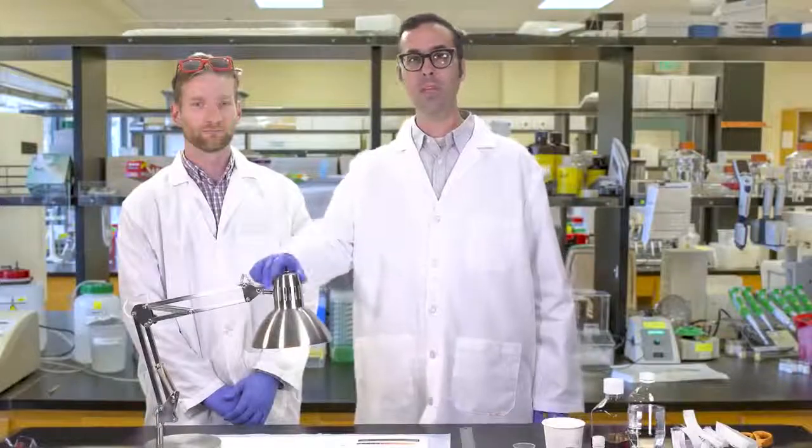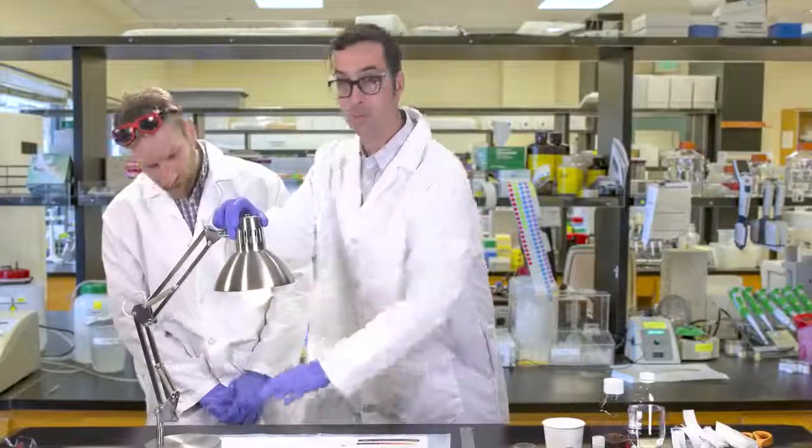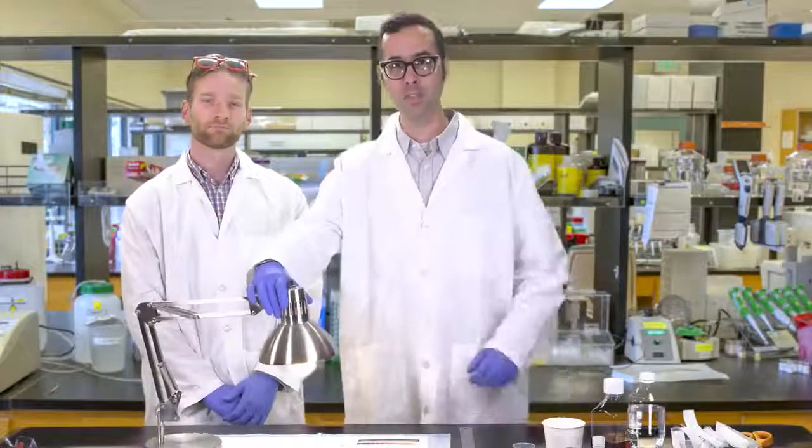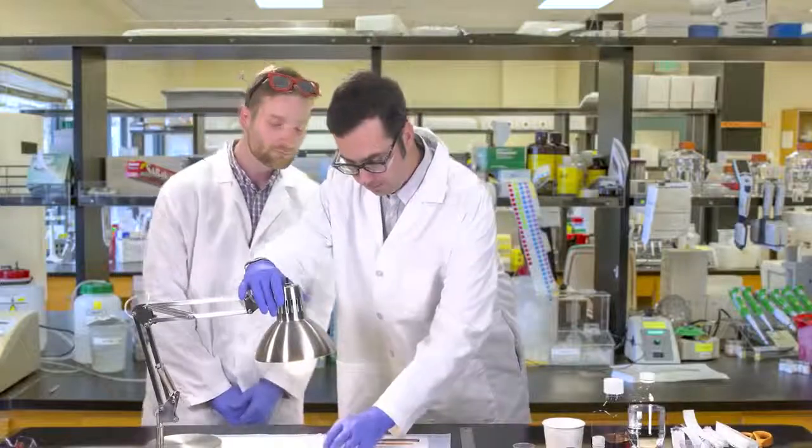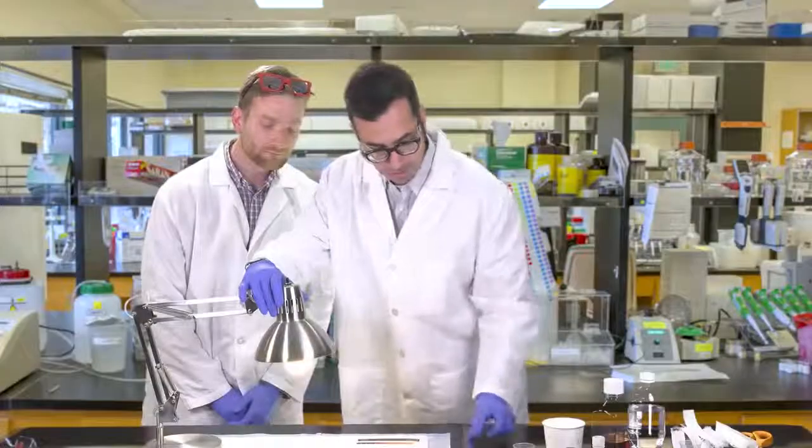Two, the light shouldn't be too close or too far from your beads. The cuvettes should be placed on their sides under the light approximately 15 to 25 centimeters from the light source.